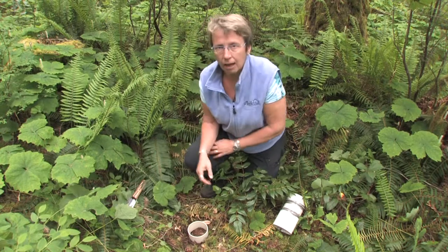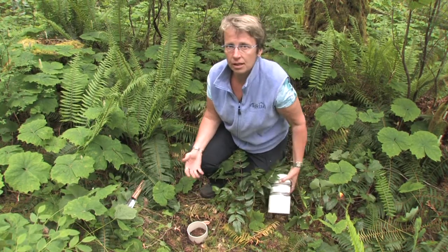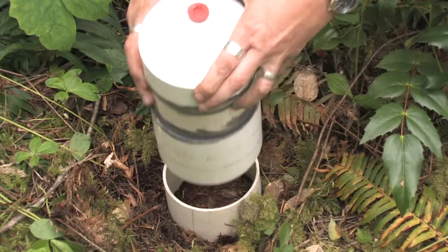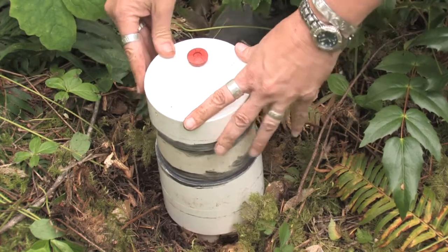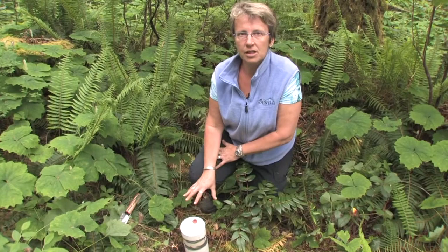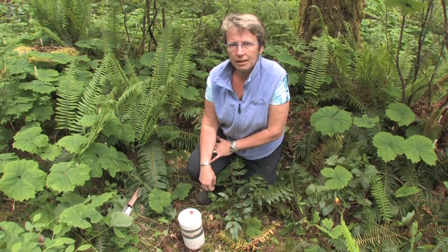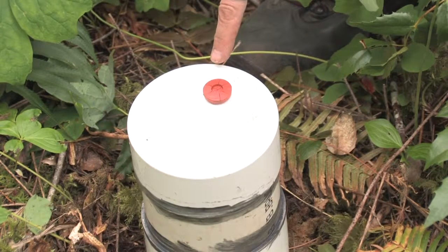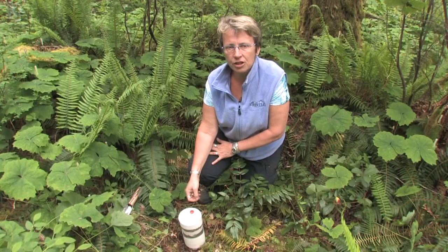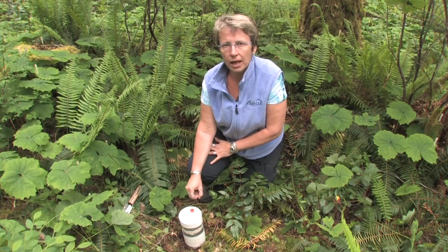When we come to take gas samples for carbon dioxide, nitrous oxide, and methane, we place the chamber on top — this is an airtight chamber. We leave this in place for the system to equilibrate for an hour before taking a sample of gas using a syringe. There's a superseal on the top here and we use a syringe to take a sample of gas, which is put into an exitainer.